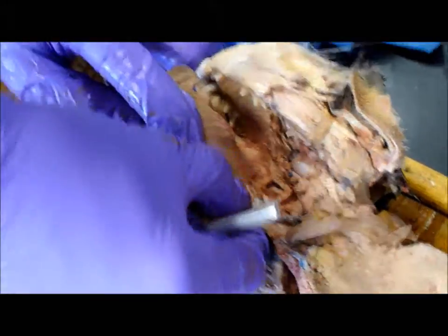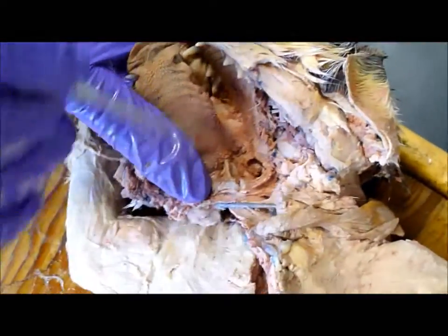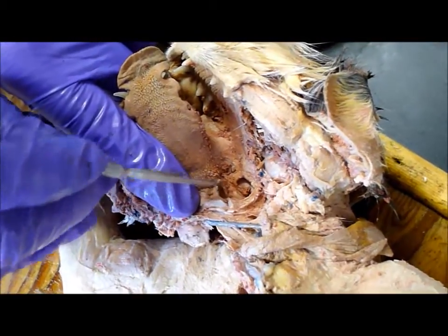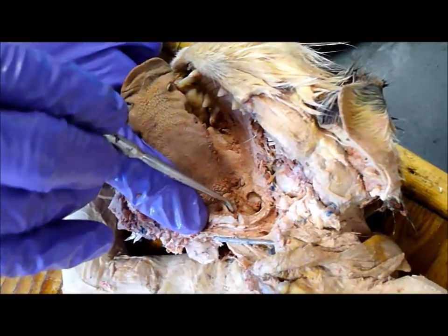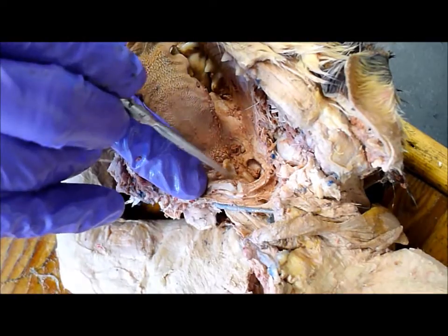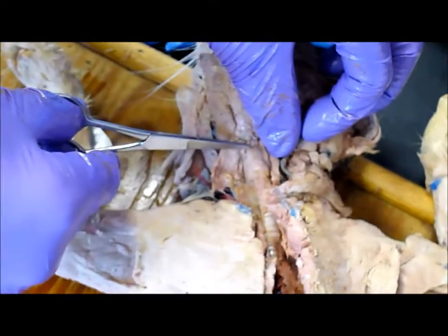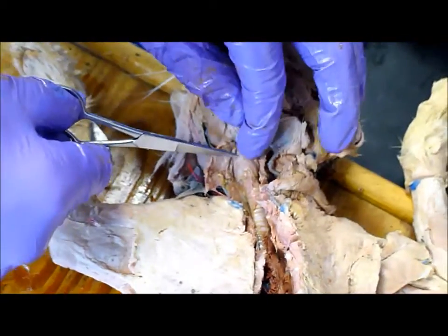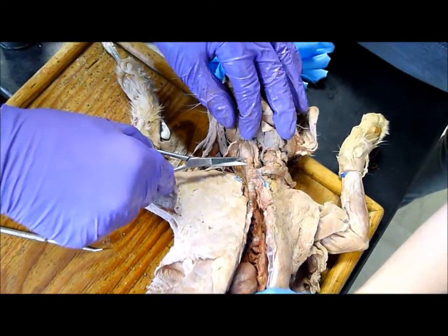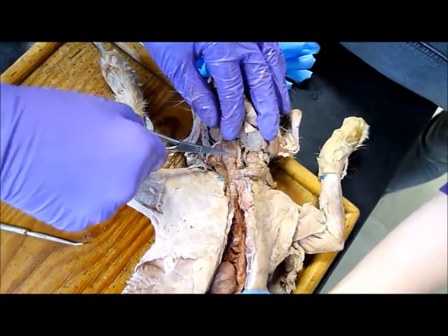Where's the inlet? There it is. That's the epiglottis — so here's the epiglottis, it covers the airway. That's the glottis; the glottis is the hole. This cartilage is the thyroid cartilage, and then this gland right there is the thyroid gland.